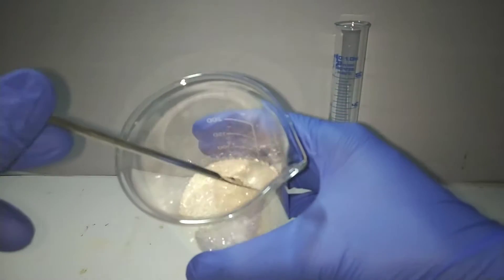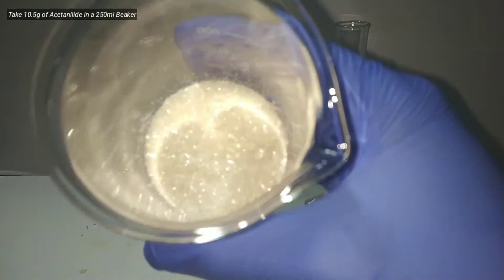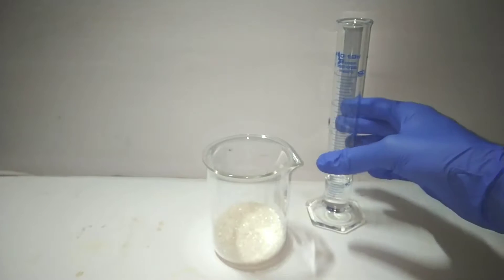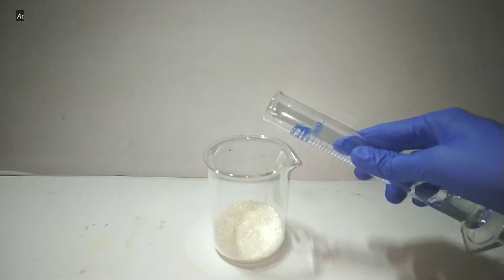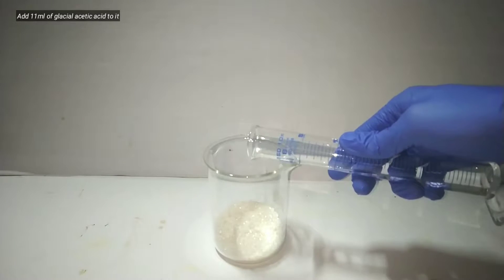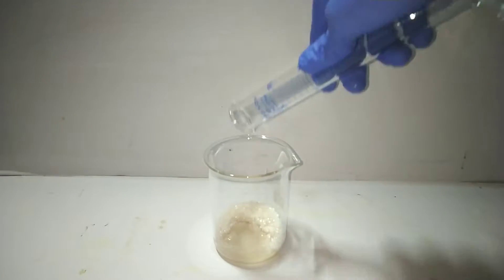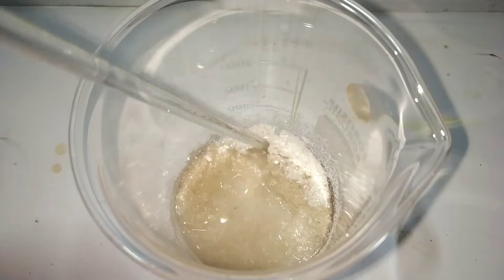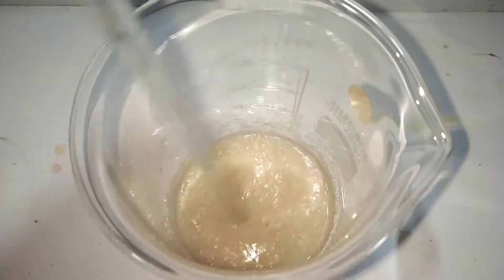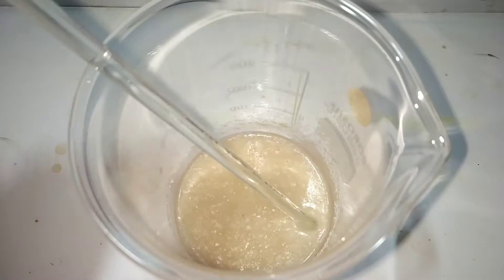We proceed with the synthesis of paranitroacetanilide. Start by taking 10.5 grams of acetanilide in a 250 ml beaker, then add 11 ml of glacial acetic acid. With a glass stirring rod, mix the contents very well. The mixture was then gently heated until everything dissolved, leaving a clear solution.